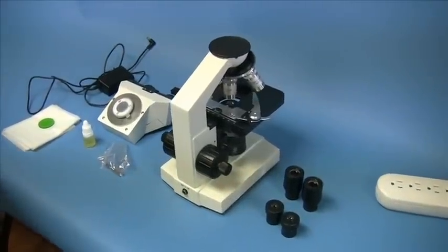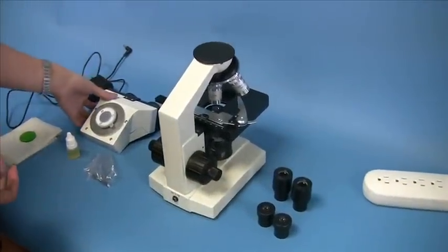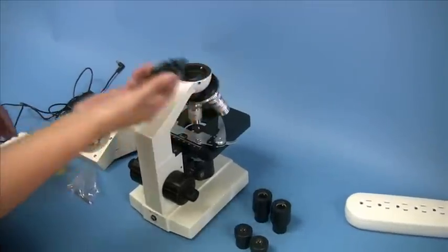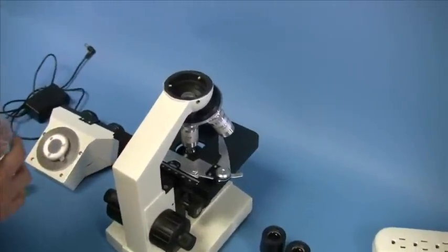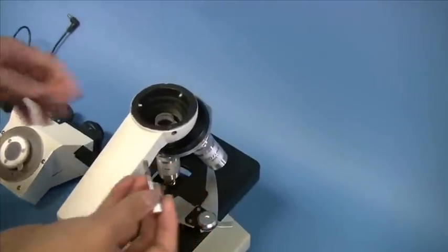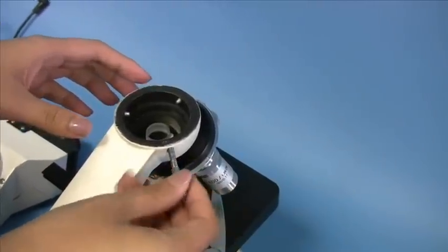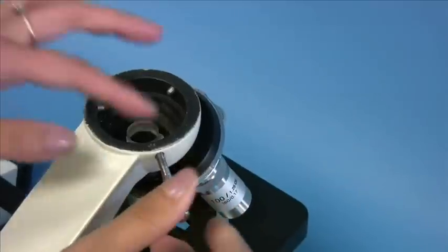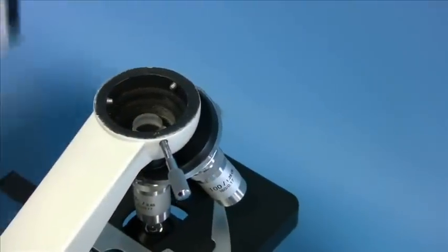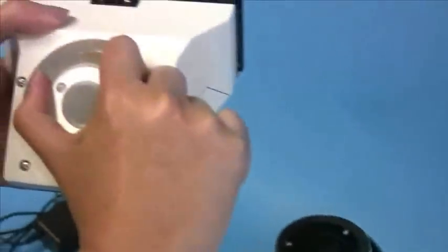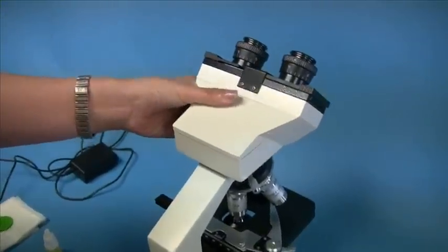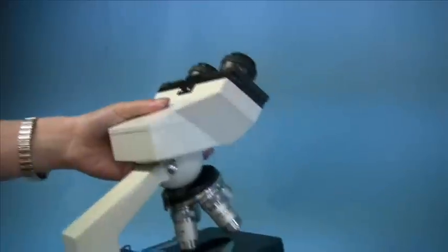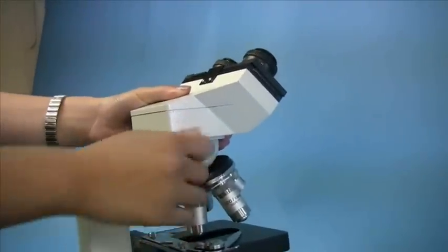So now you're ready to assemble the microscope. First, I'll start with the binocular head. Simply remove the cap on the microscope body and screw the headlock thumb screw in very loosely, just a little bit. Now take the binocular head and remove the cap, and insert the head in the body like this. Make sure that it's seated completely and tighten the headlock thumb screw.